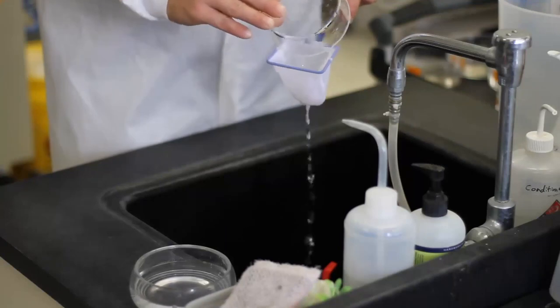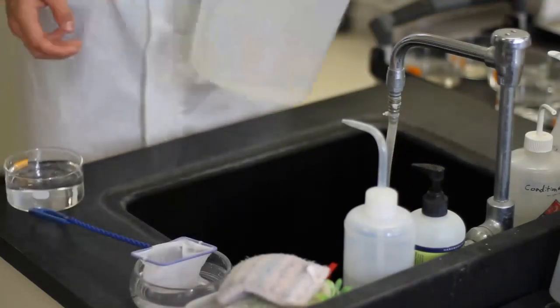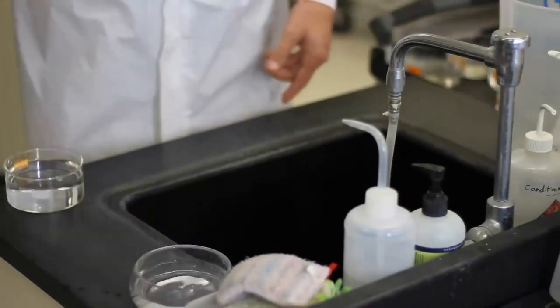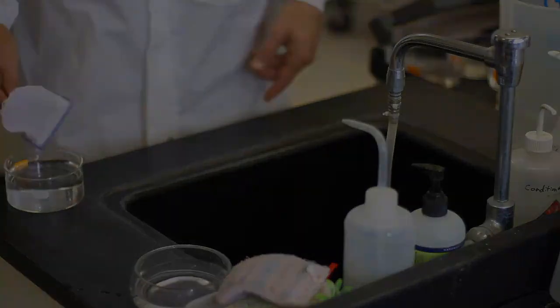The day prior to the assay, after three days of acclimation, replace water in the assay chamber with fresh conditioned water. On the day of the assay, fish are deprived of food until after the assay is completed because satiation will change their response to vibrations.